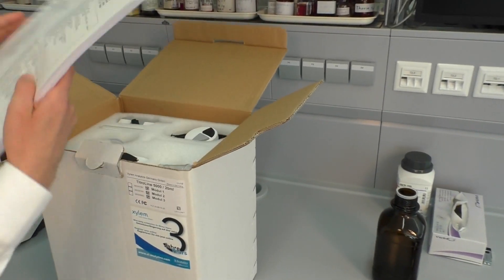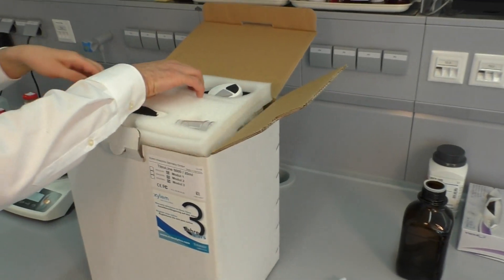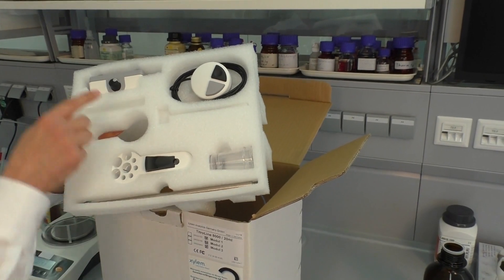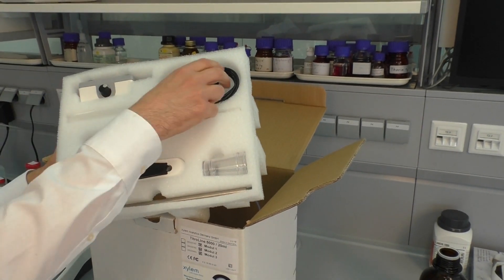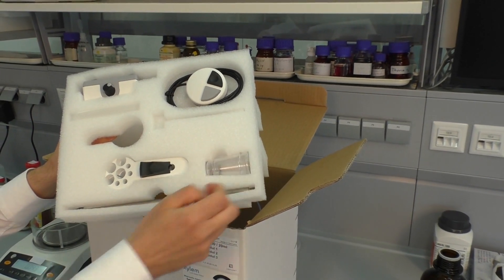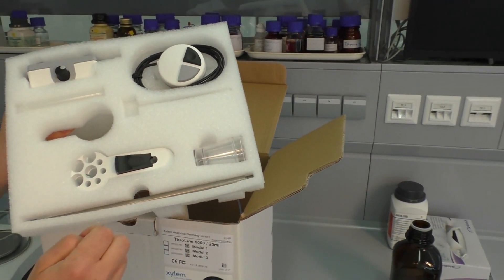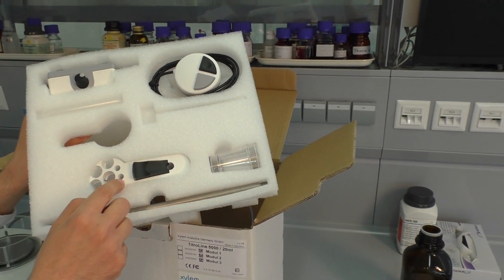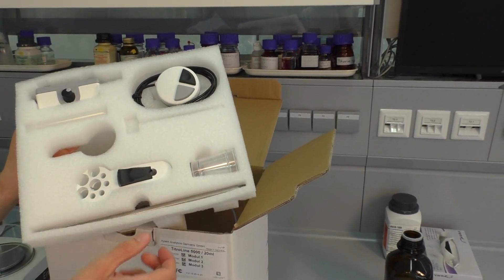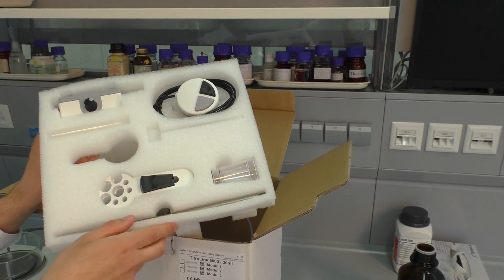Part of the delivery is a manual. We have a magnetic stirrer, a hand controller for manual titrations, two little beakers to perform a calibration of the pH electrode, a titration clamp to fix the titration tip and the pH electrode, a stand rod and a little vessel to store the titration tip.